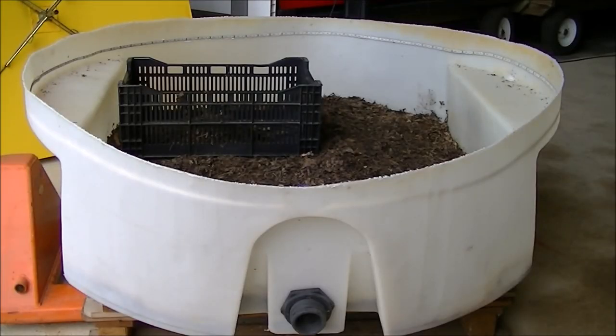Today I'd like to show you what's alive inside my worm bin, if anything besides worms. Is there any microbes and what type of microbes are growing inside this worm's bin in that organic matter and worm castings.